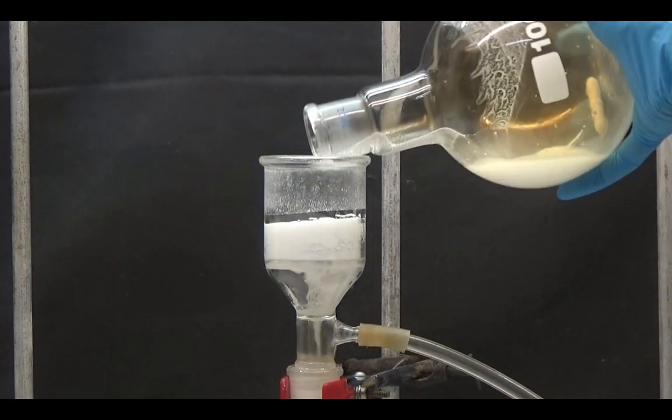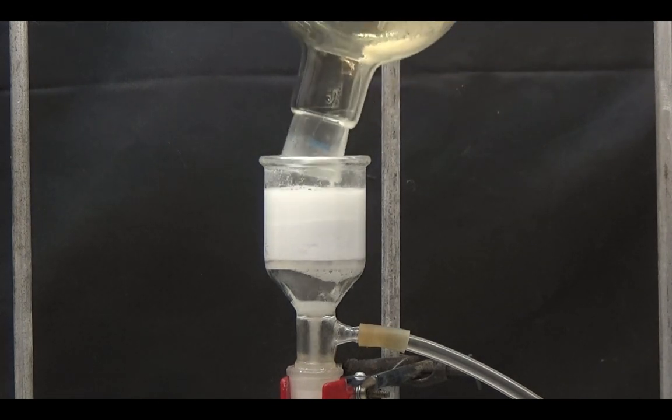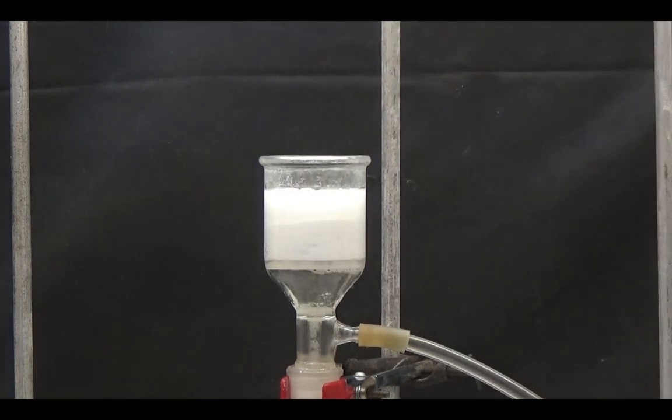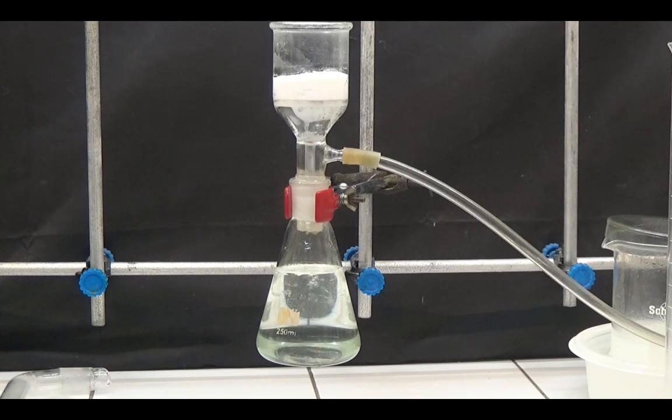Wash the flask with another 125ml of water to remove all trapped solids. Filtered liquid must be completely transparent.